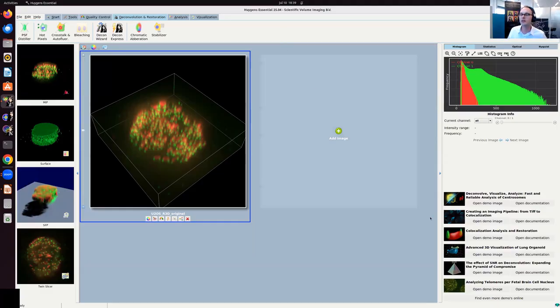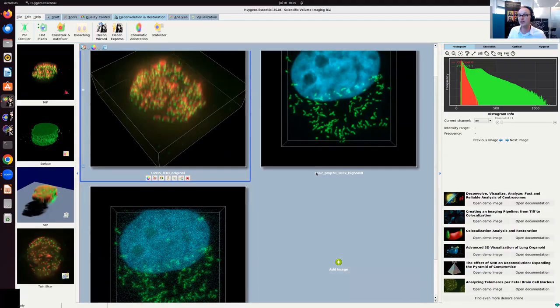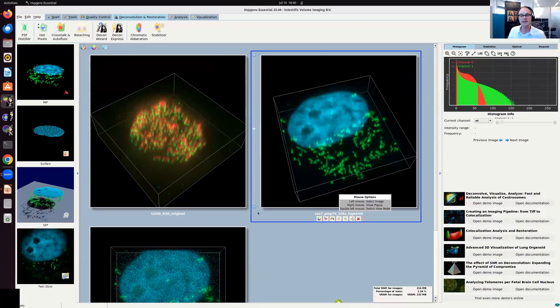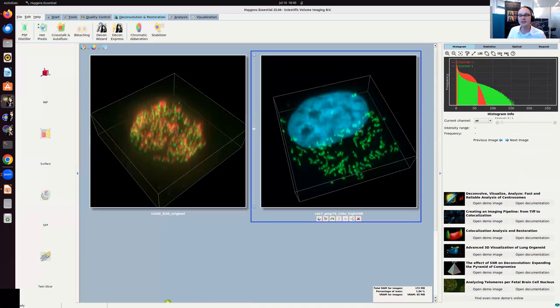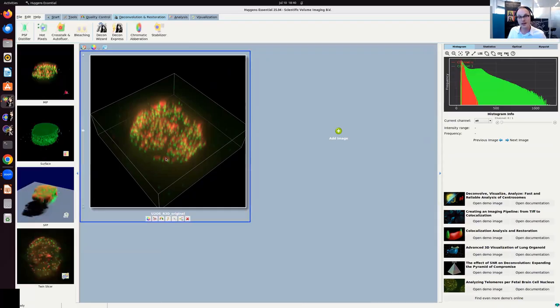Now, before I go on, I'd just like to point out, I've been talking a lot about the SNR effect in the introduction. You can also find that demonstration now in Huygens. This is the high SNR, and this is the low SNR data. There's really a 20 times difference in intensity. You can just open that in this demonstration. I will not do that now. I just wanted to point it out, and you can look at that at your leisure later.